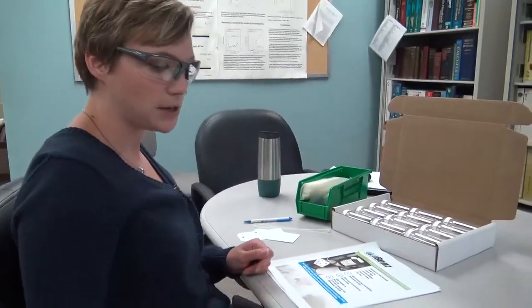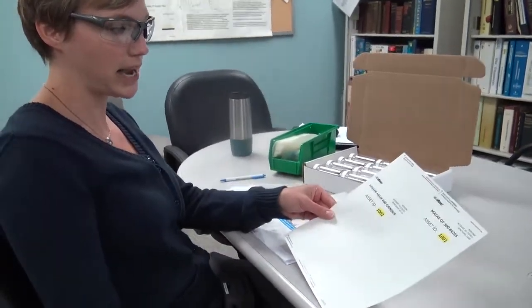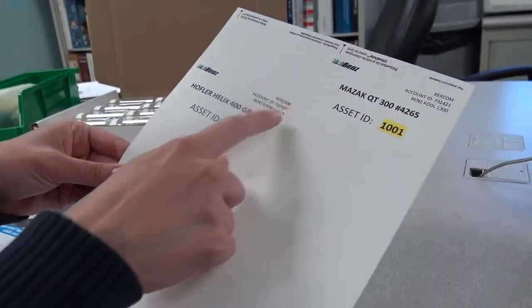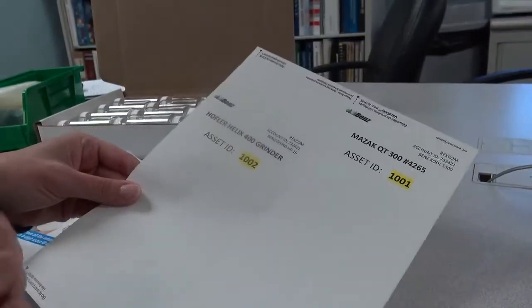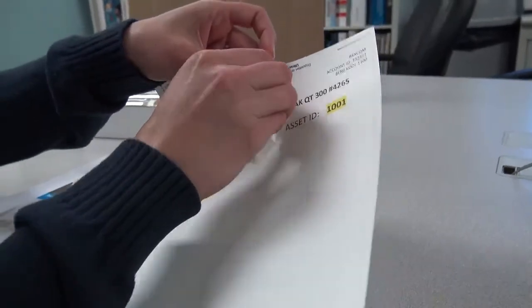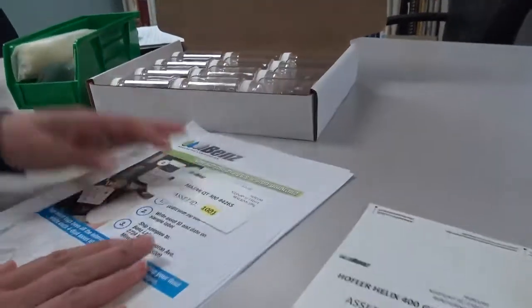So the next step is going to be assembling the customer kit that we send to customers. So I have created some stickers that have asset 1001 and asset 1002. In the corners they have the different products that these have and the descriptions for the different assets that Joel provided us. So these stickers get attached to an asset tag, and these are chemical resistant stickers, so they should hold up in the plants. So we'll just put that on here.